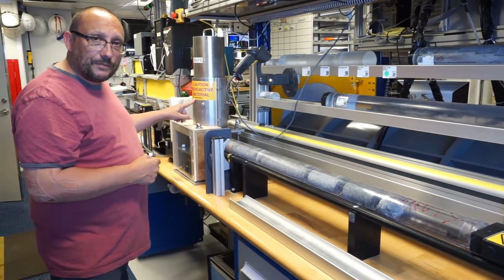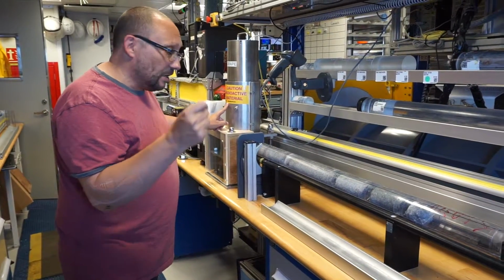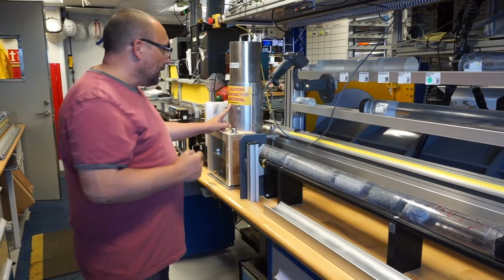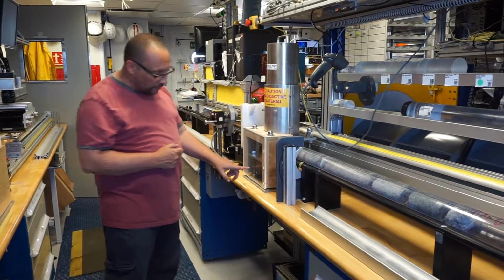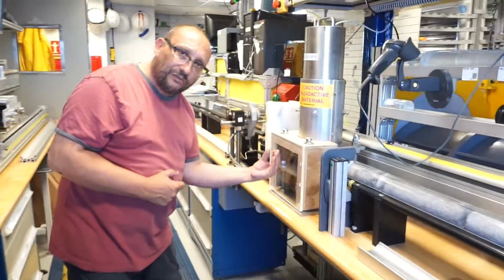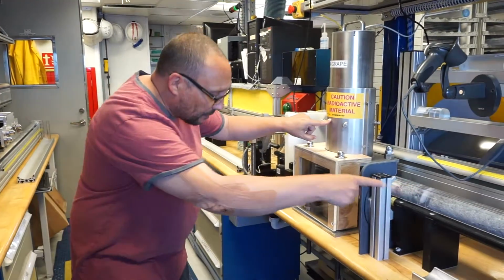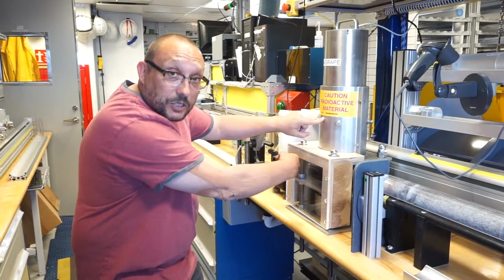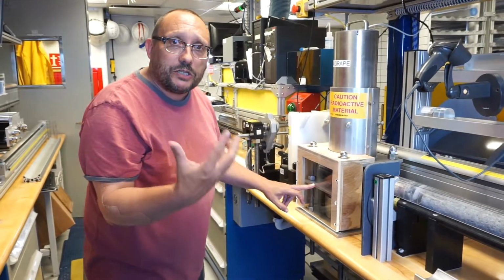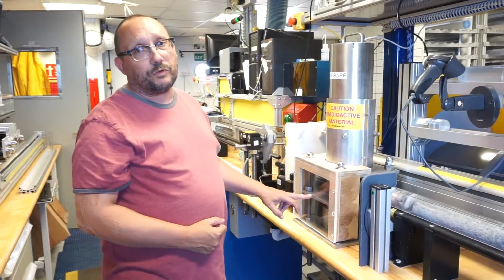The first one here is an instrument we use to measure density. The density of the rocks is somehow a measurement of how heavy they are, okay? And to measure that, we use a small radioactive source here, which will emit gamma rays, and we will measure the gamma rays on the other side. That's going on now. The core is going through this measurement device. The amount of gamma ray absorbed by the core is proportional to the density, which is a property we want to evaluate.